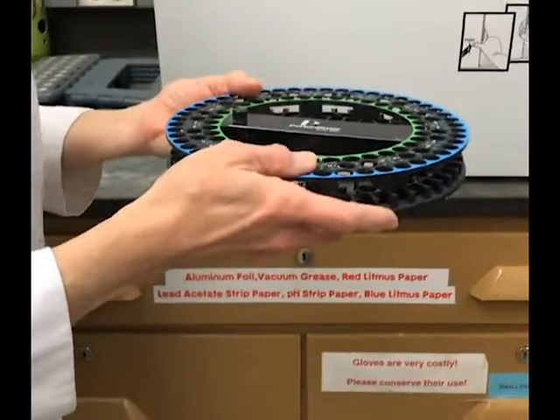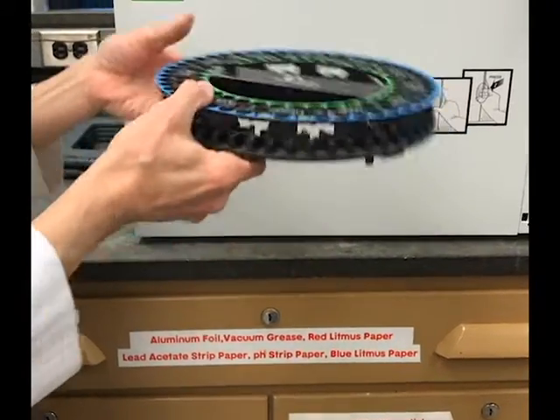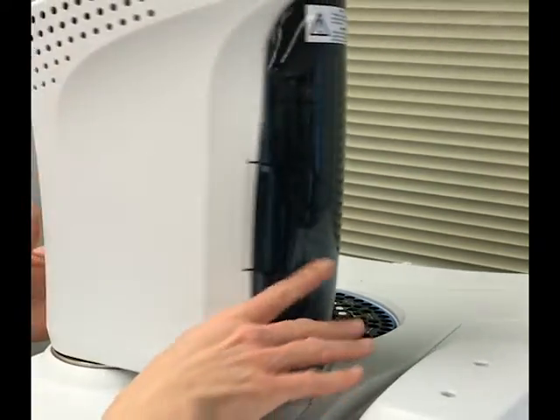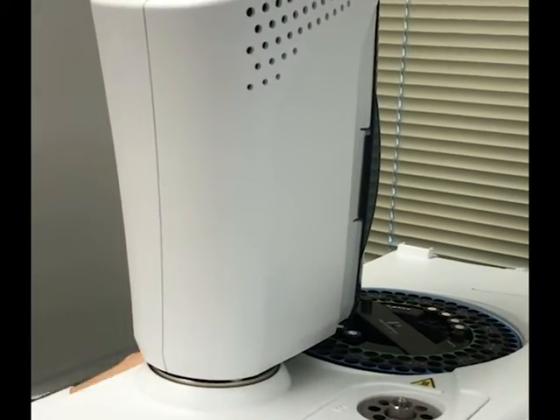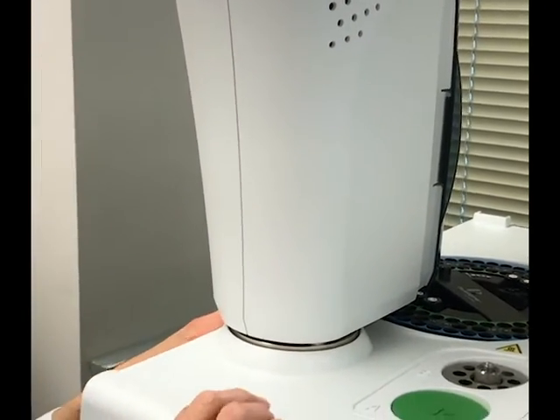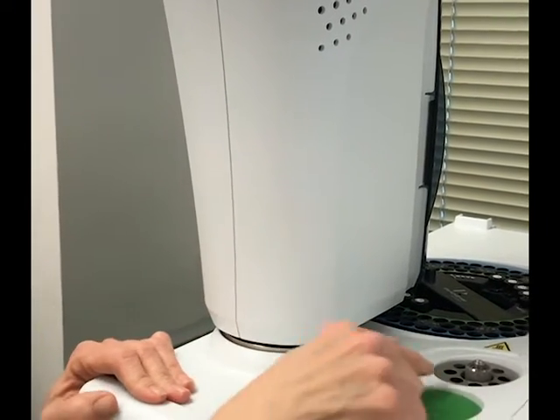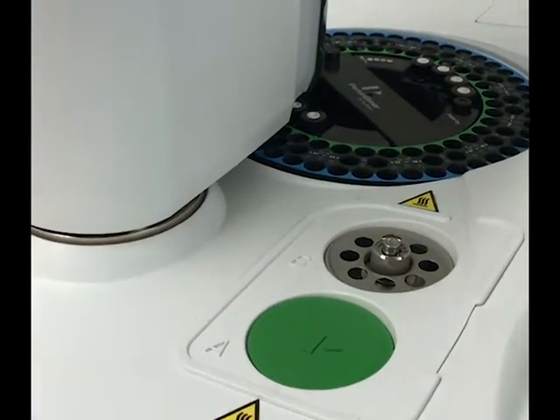Samples are in a sample holder or a carousel in a capped vial that goes into the machine here, and the syringe in the carousel moves such that it pulls up the solution that we're analyzing and then injects it into the injector, which is right on top of here.